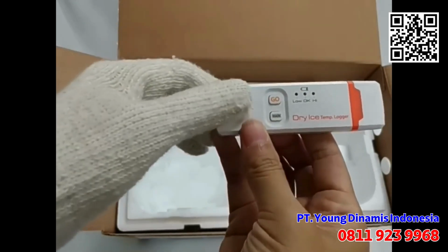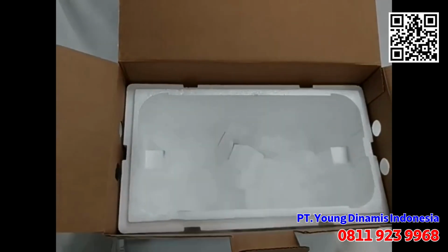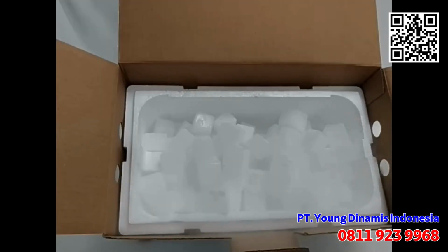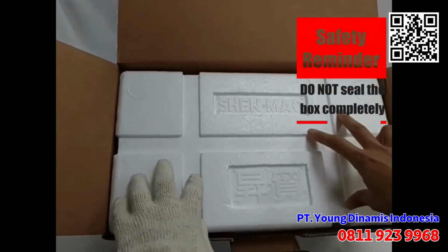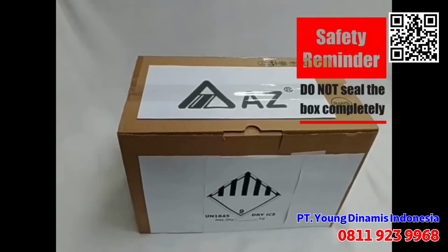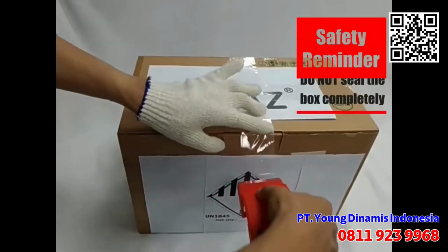Place the logger into the dry ice transportation box you prepared. The required dry ice is dependent on sample weight and transportation time. Don't completely seal the transportation box. Consult your transportation provider or run a trial testing ahead to ensure the dry ice is enough.